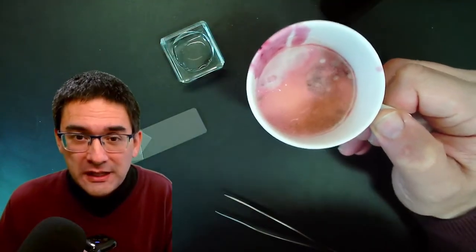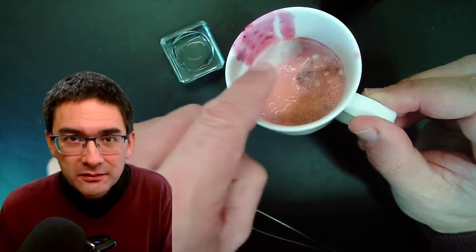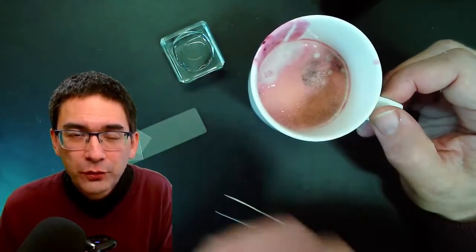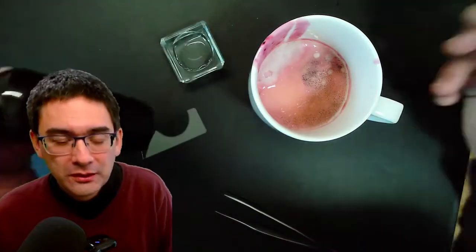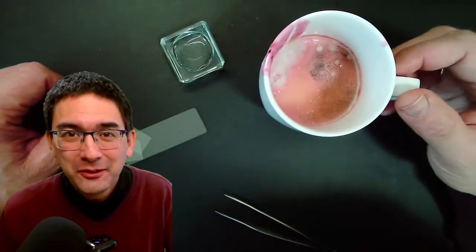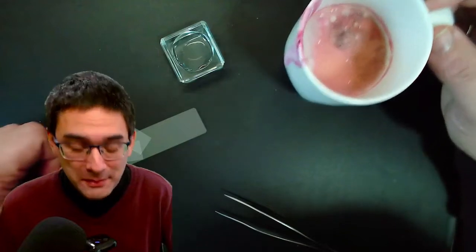So what I'd like to do today is I'd like to put both the mycelia, that's the fuzzy white stuff, and also the spores which are formed by the fruiting bodies under the microscope. And I've got over here also some methylene blue solution to do a little bit of staining. So I'm just going to try it out. And this way you can also know how to prepare microscopic slides and specimens.